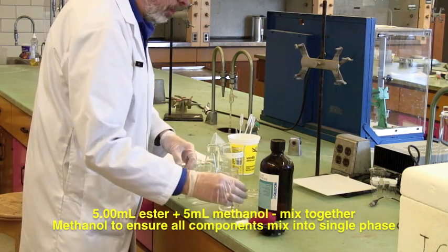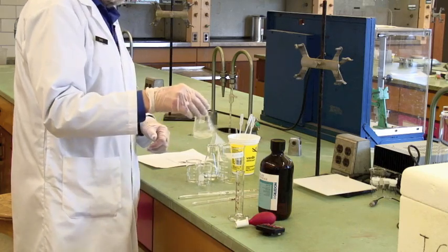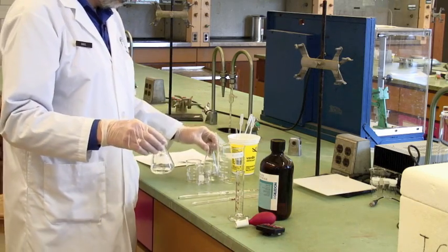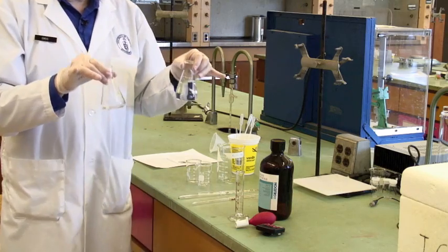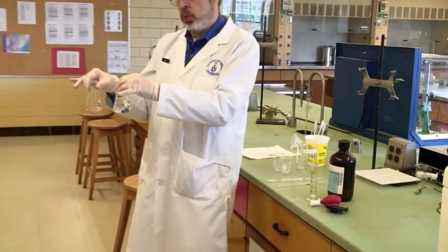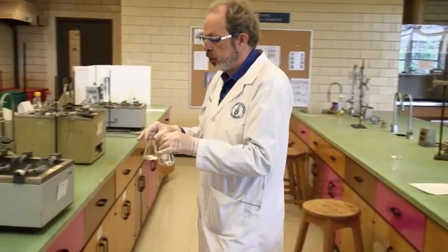So, that's 10 mLs of methanol-ester mix and 100 mLs of hydrochloric acid. These now come over here to one of the constant temperature baths.